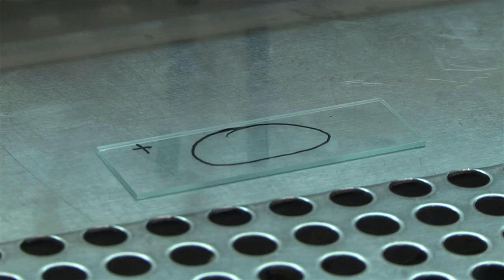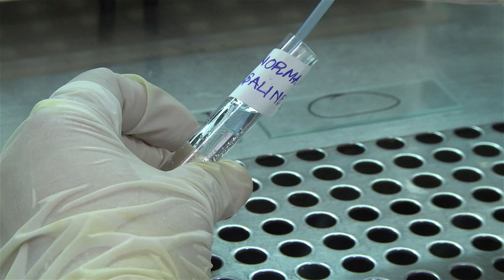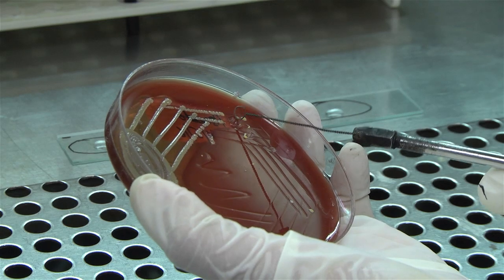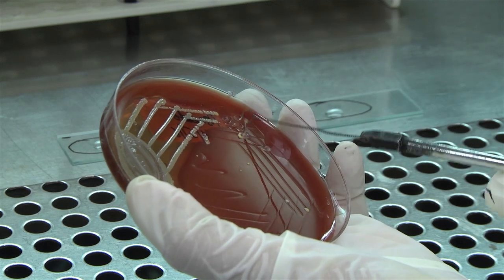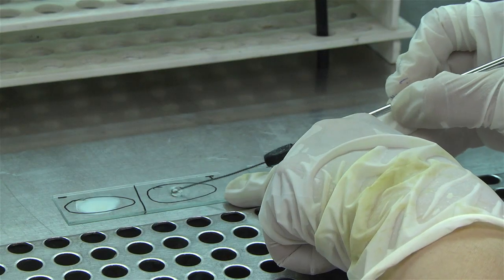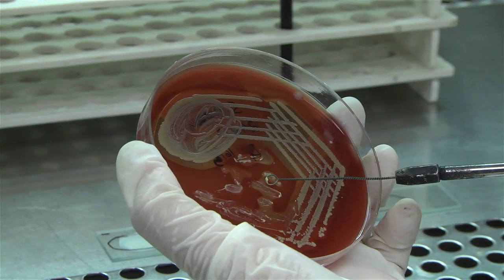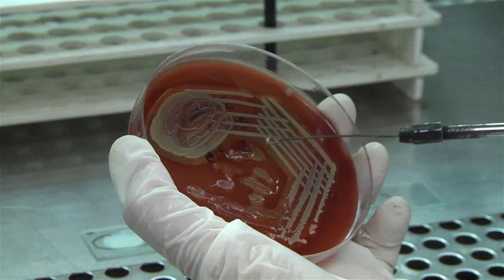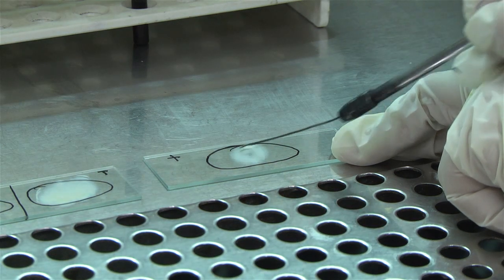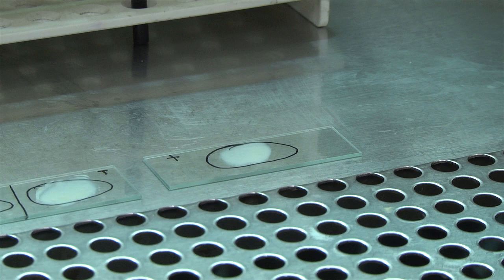Take another slide, draw a circle on the undersurface and label it for the positive control. Place a drop of saline on each of the three circles. Pick one to two colonies from the test sample with a sterile inoculating loop and gently emulsify the colonies in saline on both sections of the test slide. Similarly, pick one to two colonies of a known strain of Staphylococcus aureus and gently emulsify in saline on the positive control slide. The emulsified colonies should look milky white in colour.